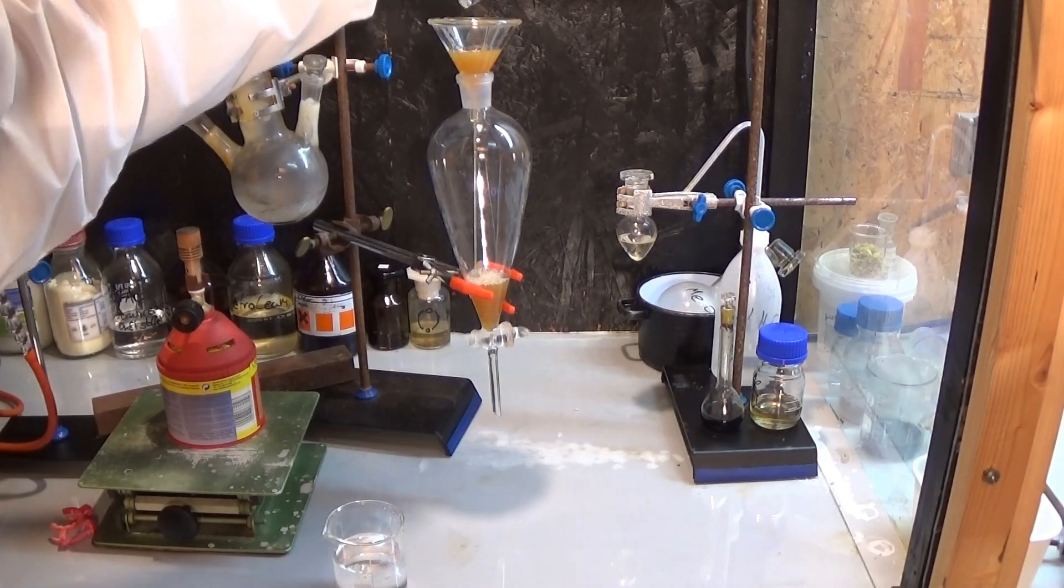At the end of the reaction you end up with a reaction swamp that should look like this. Nice and toxic, like lakesides in the land of freedom to shit on environmental protection. But now let us make this raw styrene great again.